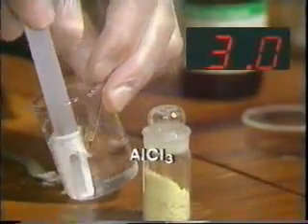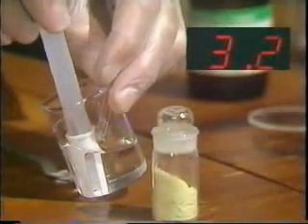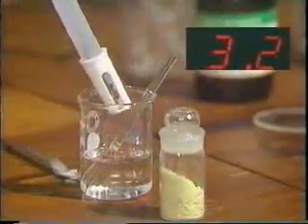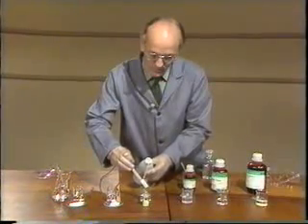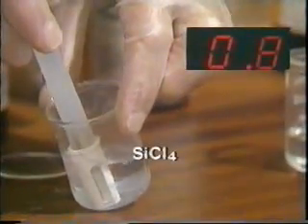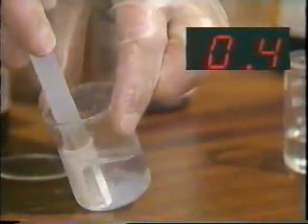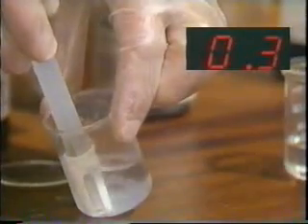Now here we've got a very definite fall in pH, down to 3.2. Rinse the probe carefully. On to the next one, the silicon tetrachloride. And you can see here that the pH has dropped right down to 0.4, 0.3 even.